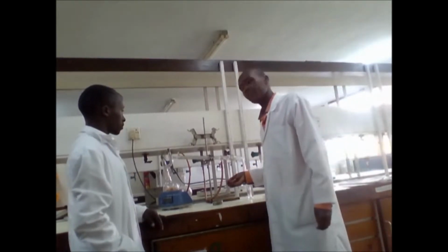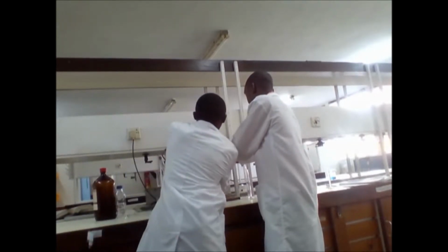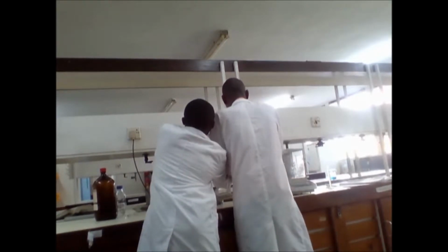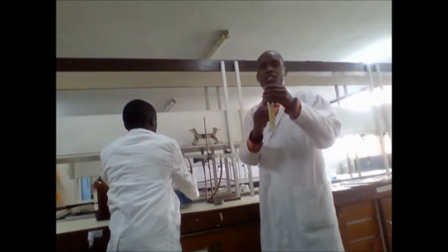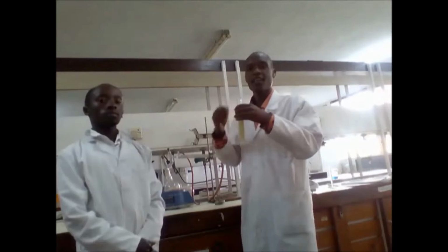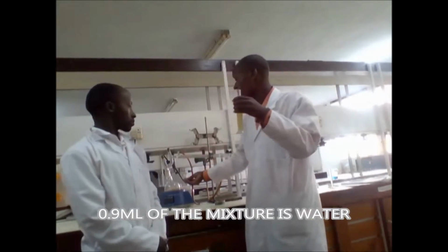Then finally, you take the mixture collected, because this is a mixture of toluene, which is the organic solvent, together with the water. But the water will be found in the lower layer because it is denser than the solvent which was used. So you take the mixture and cool it at room temperature, and finally you read the volume, and therefore you will be able to get the volume of water which is collected from that sample.